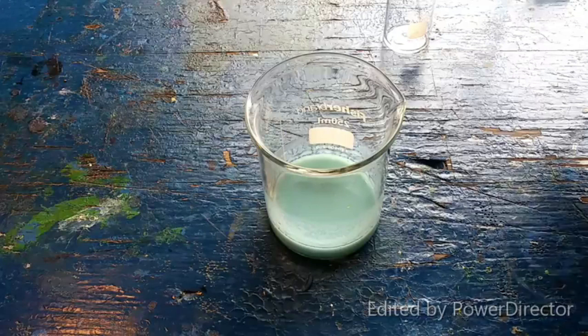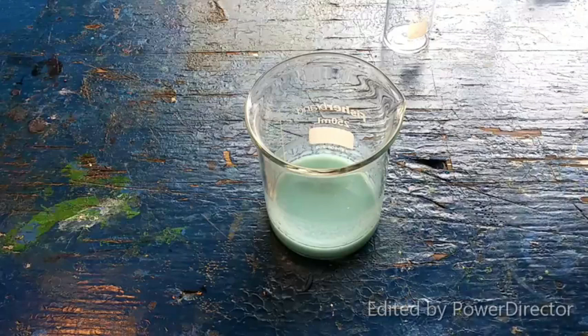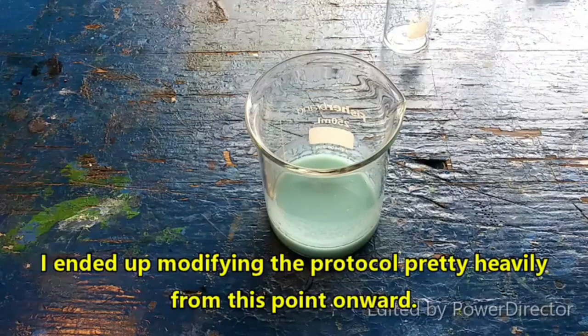Then we will transfer that to an evaporating dish, evaporate it down, and once we start to see crystals, we'll put it in ice, and then we will crystallize the compound, filter it off, bottle it. So very simple, very easy synthesis. I will come back once I've got this filtered and I'm ready to move on to the next part.